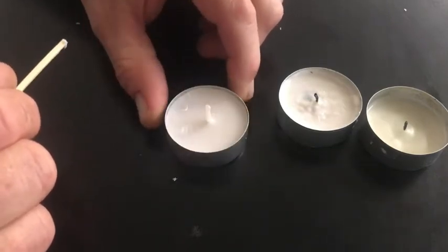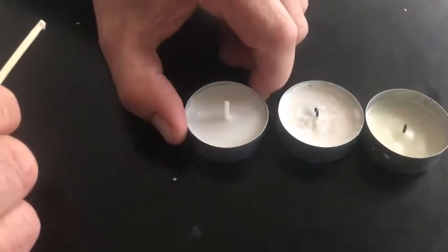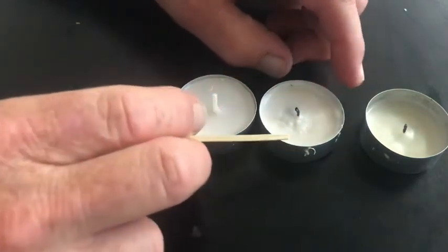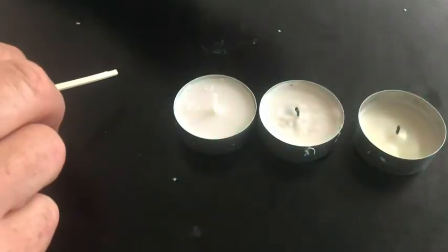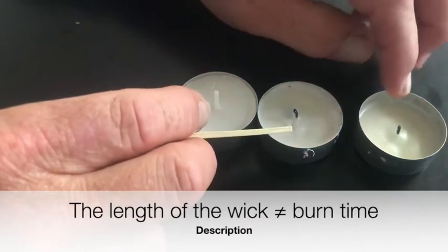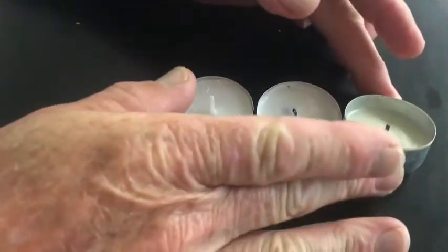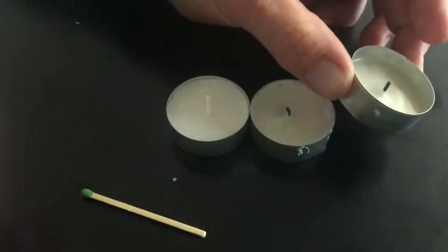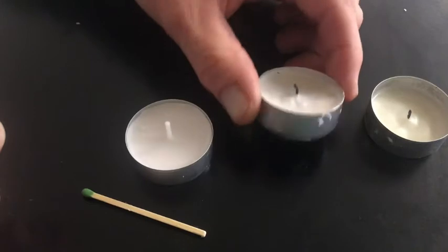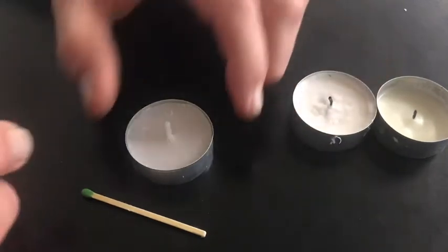I'm using a tea candle. It's the most common candle that people can buy. And when a candle burns, you may have noticed that what's disappearing is the wax, and the wick, while it's getting shorter, seems to remain the same height all the time. So here is one that's burned for a long time, and the wick is about that tall. And here's another wick that I let burn for a little bit, and it's pretty close to exactly the same thing.